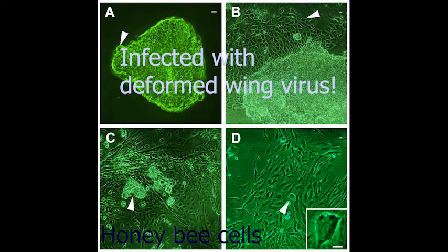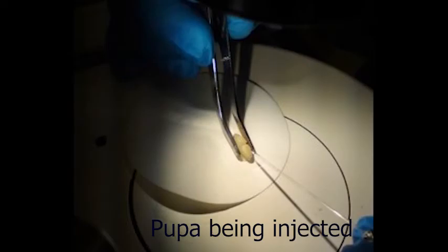And so instead, we do it a little bit differently by harvesting a large number of well developed larvae and pupae and infecting them in a controlled way with the viruses that we're interested in. They then become very infected, and we can use them to harvest huge amounts of viruses that can be used for these infection experiments.